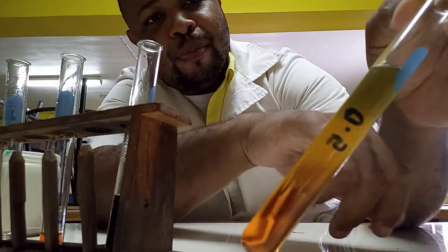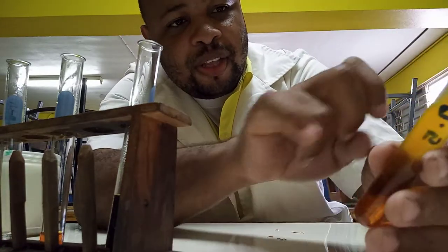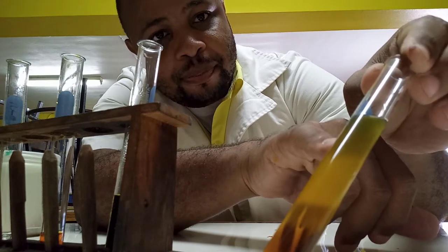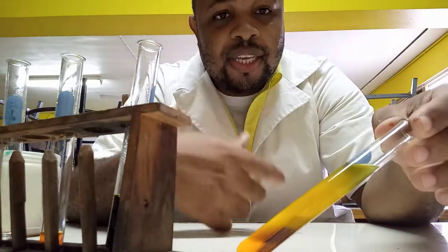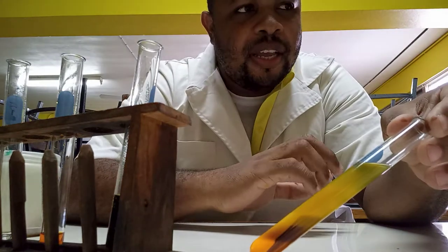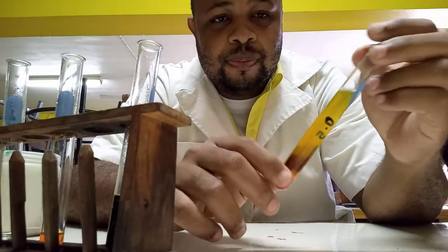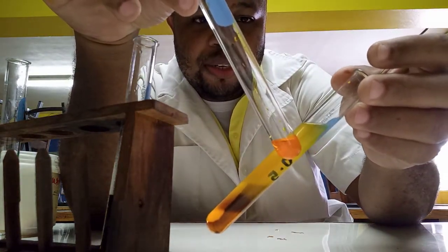You can see at the top that it is green now. The addition of the alcohol changed it from orange to green — eventually all of it will change. The dichromate, with chromium in the plus six oxidation state, is again reduced to the plus three, which means the alcohol is oxidized to the carboxylic acid. This is a redox reaction — once you get a visible change you know that a reaction is occurring.